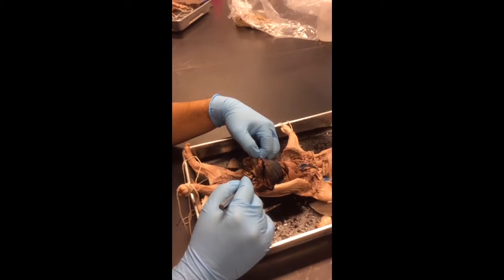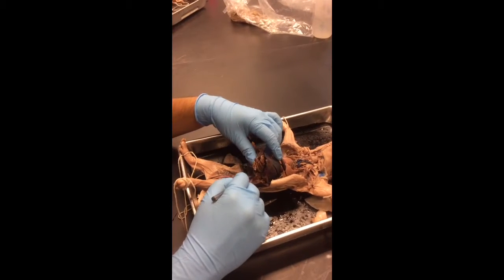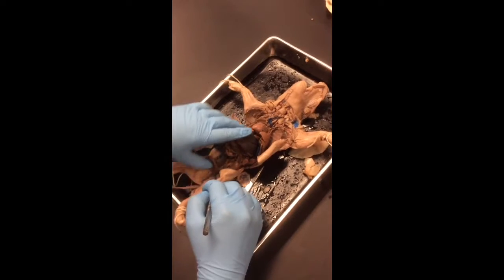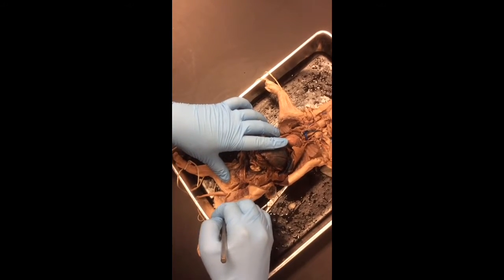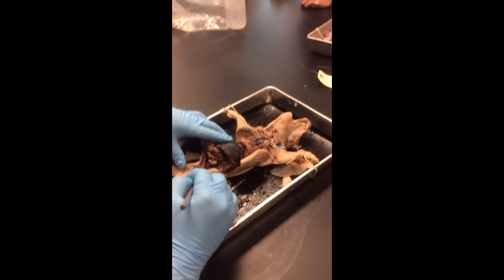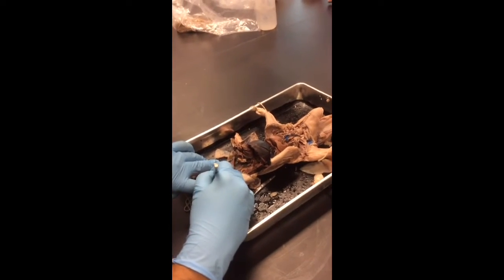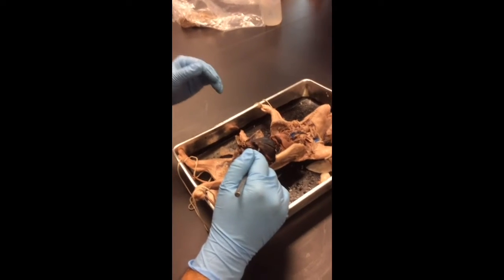Colon, so the colon is all this large intestine, right? It's going to come around, even this dark brownish, greenish color is the colon. Don't forget that. The colon also extends all the way underneath the urethra through the rectum and out the anus. Rectum and anus. Okay, so that's just the colon, right? We won't usually put in the rectum or the anus because there's really no zone of differentiation between the rectum and the colon, so we won't do that.